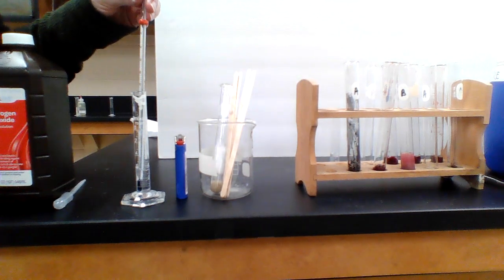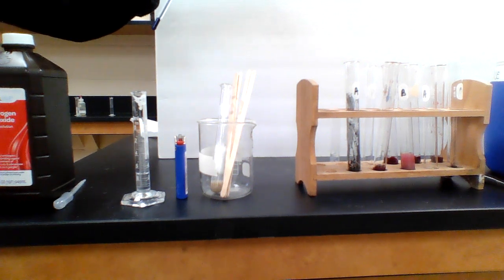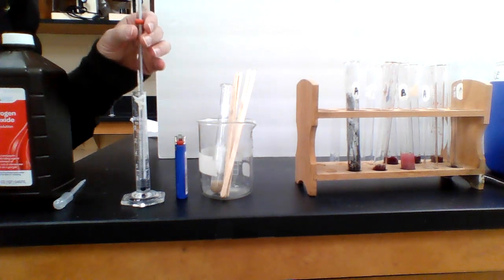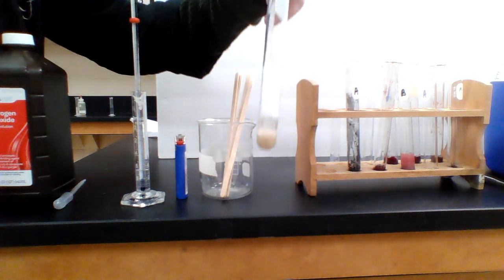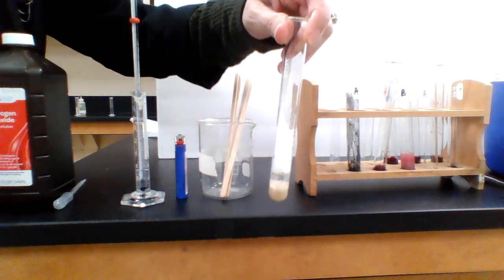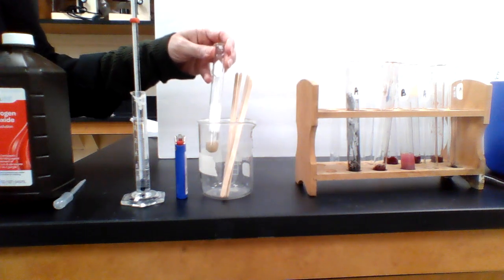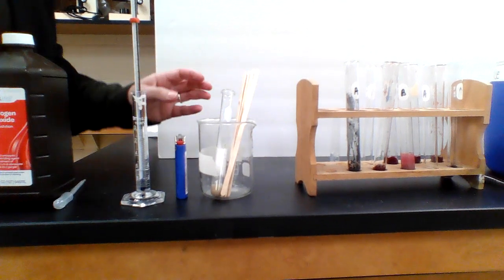So it looks like the starting temperature today is 26 degrees. And that is in Celsius, you guys. So 26 degrees Celsius. That'll be our starting temp. And while this looks super bubbly and frothy, that started out wrong. We're going to assume that the temperature change was 0.